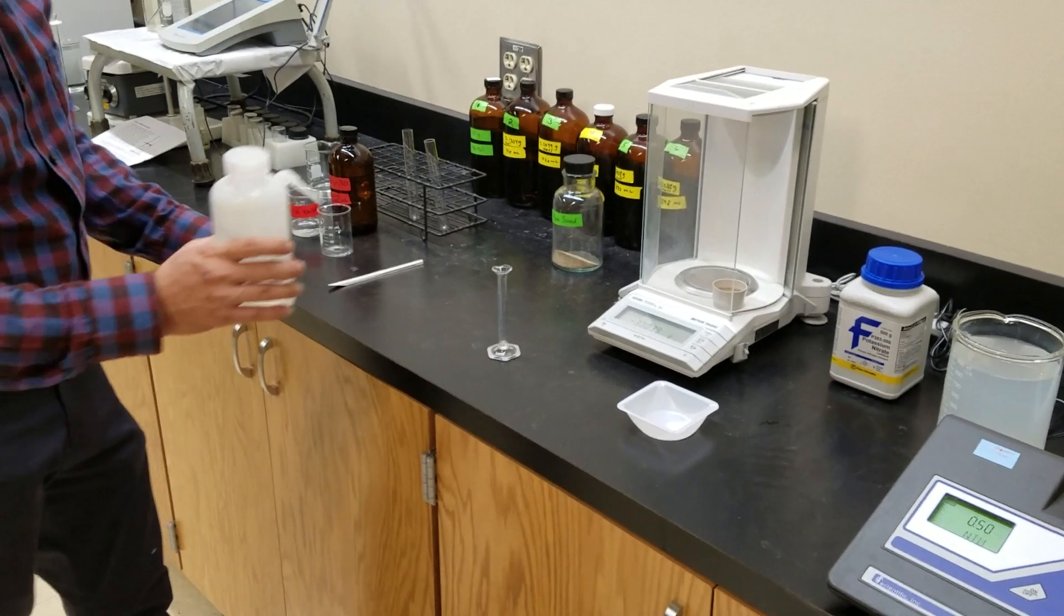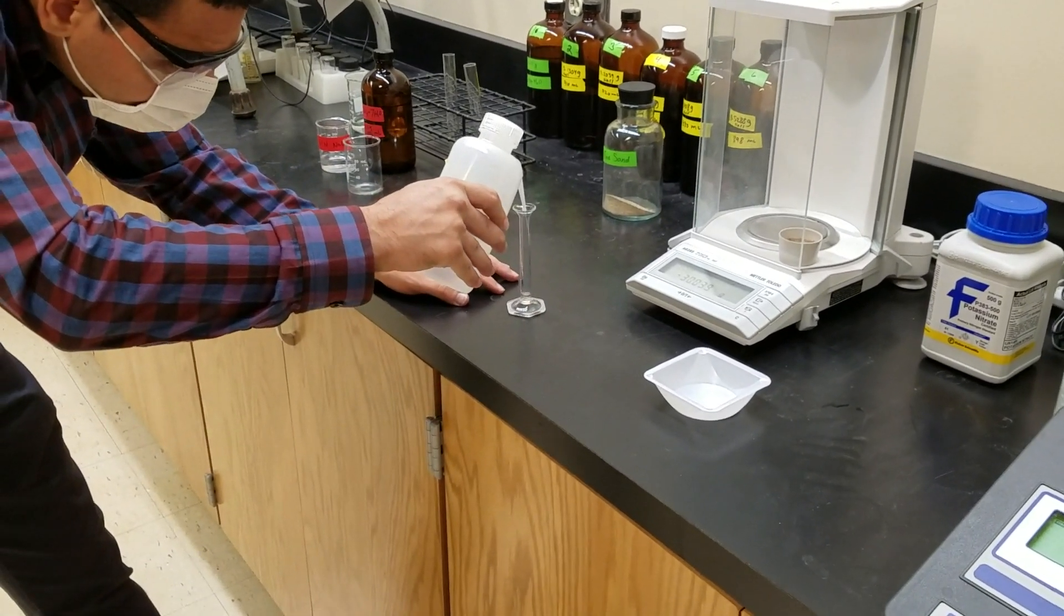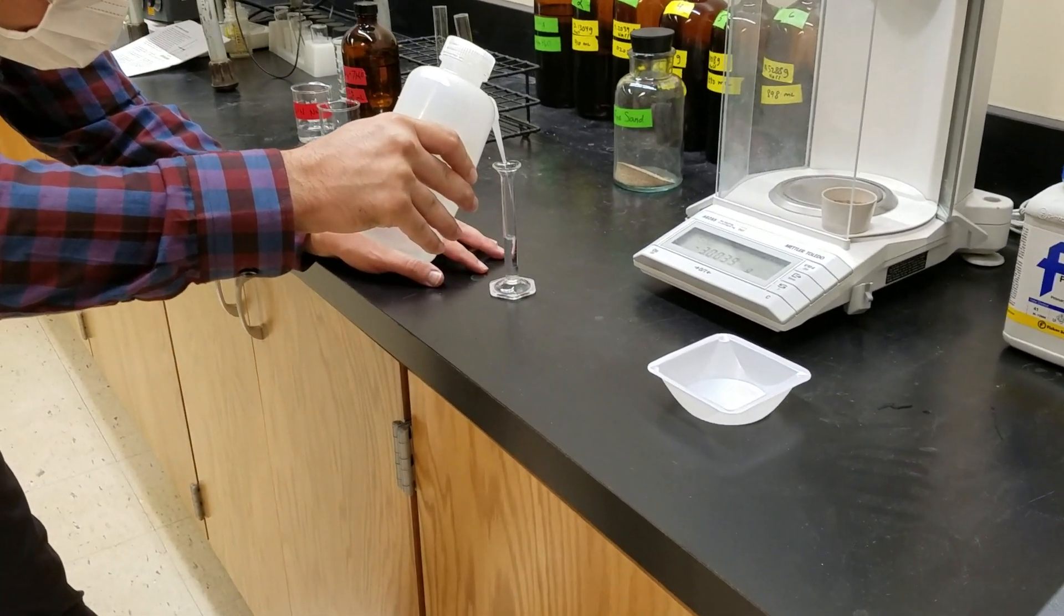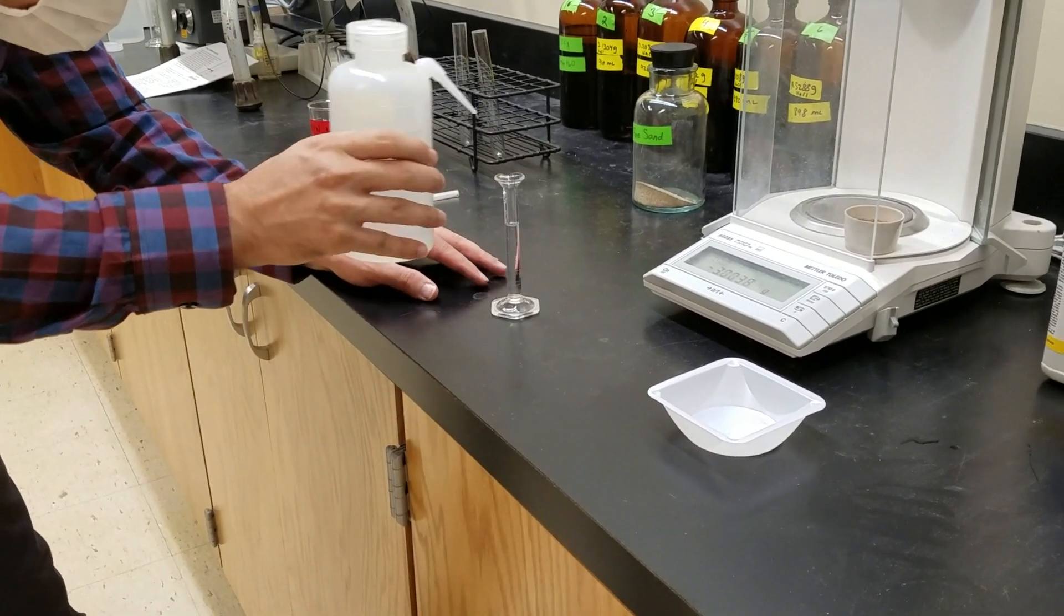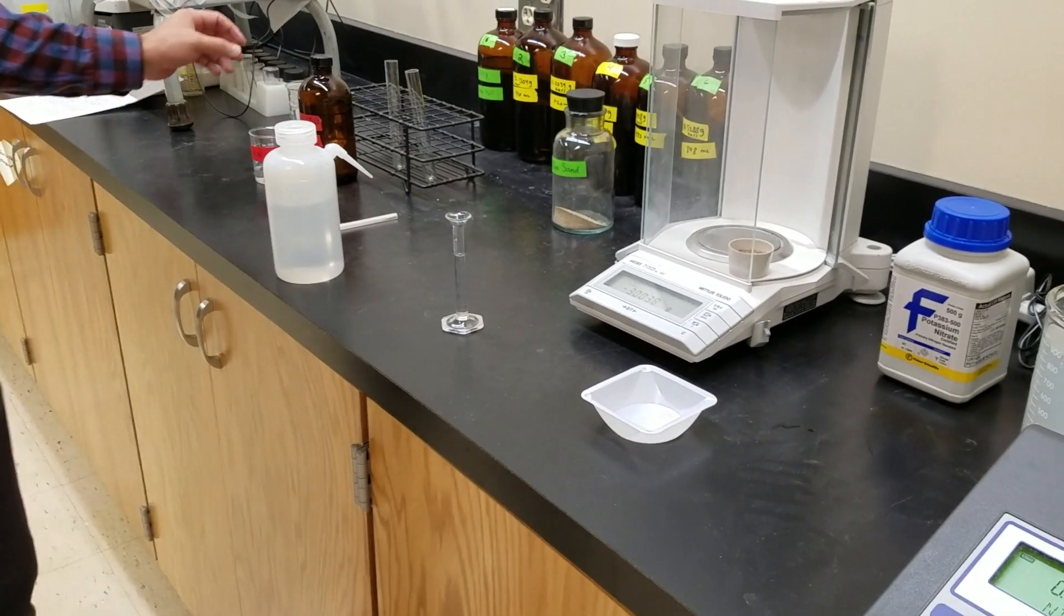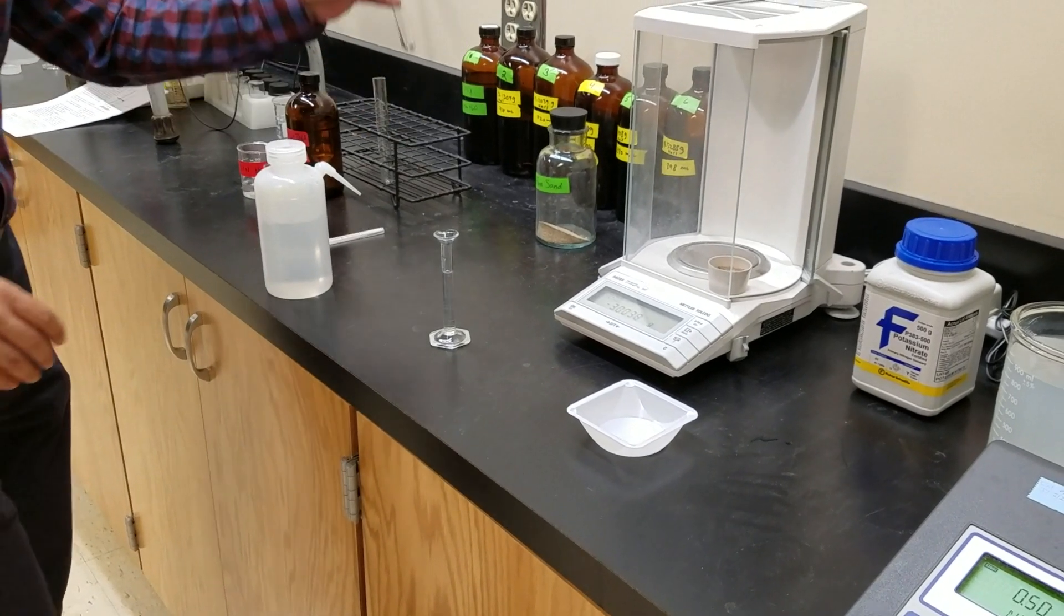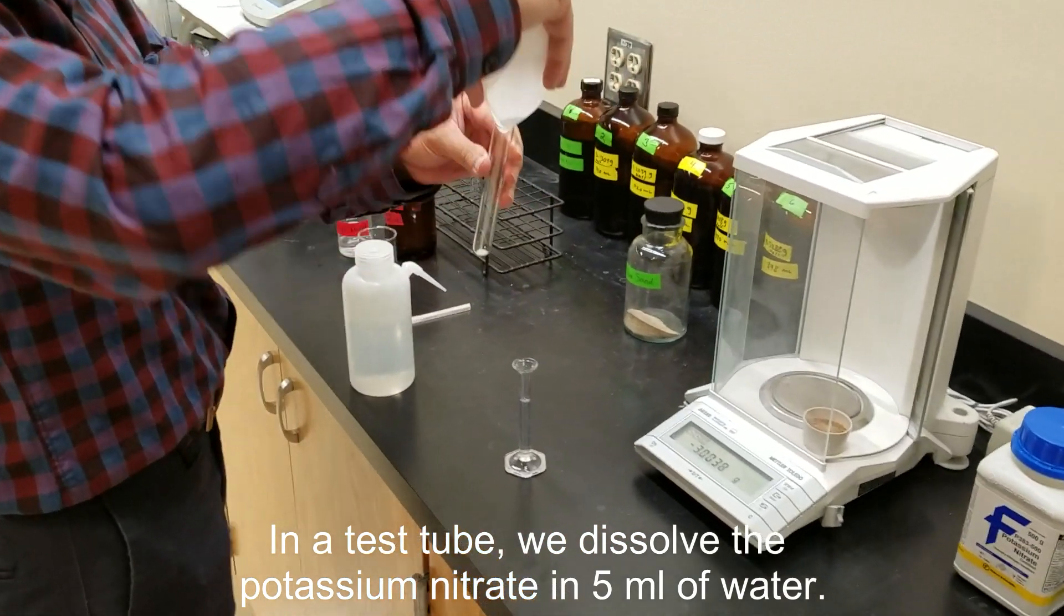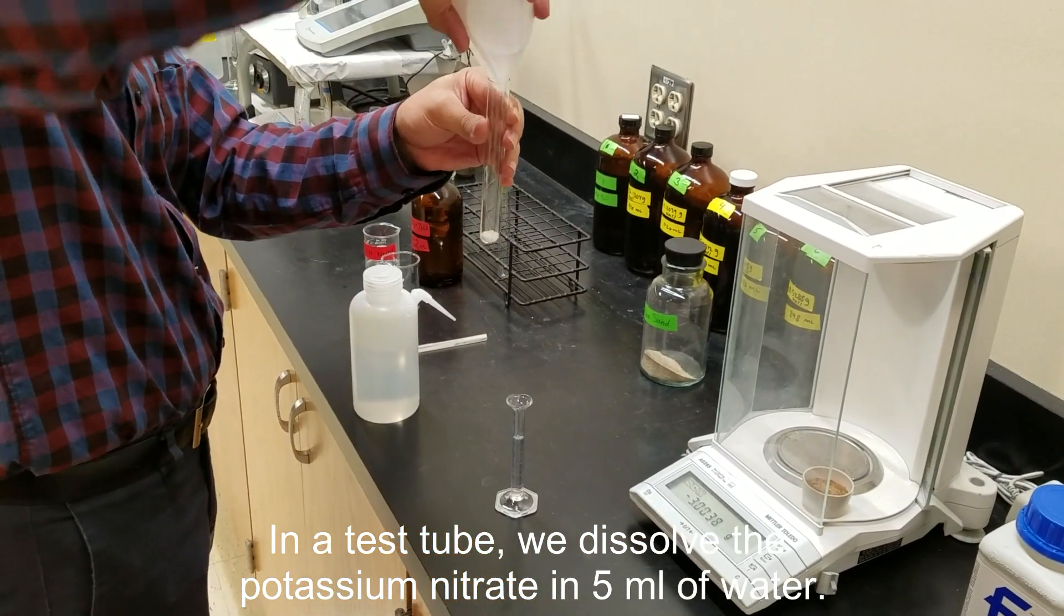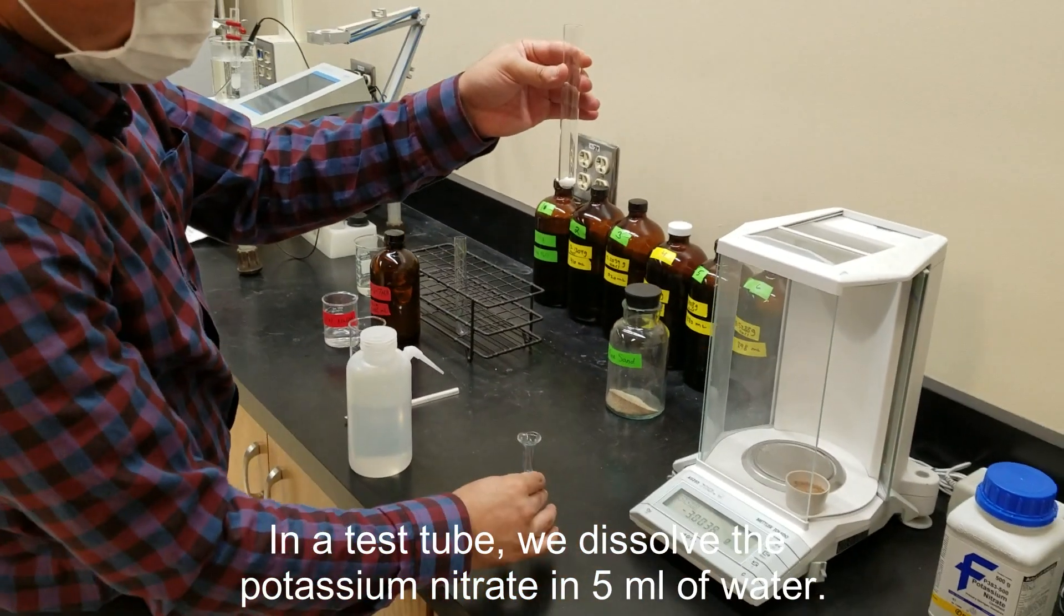After we've recorded that in our notebooks we'll carefully measure out five milliliters of deionized water and we'll dissolve our potassium nitrate in our water.